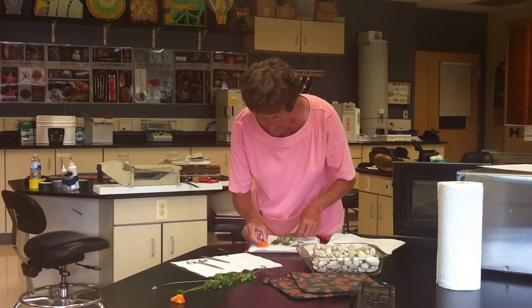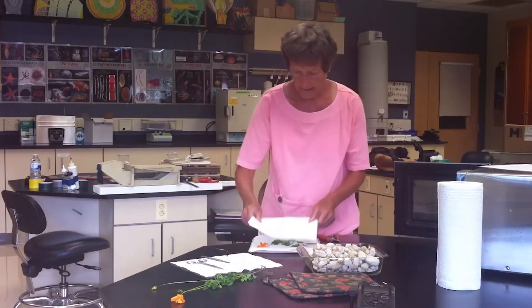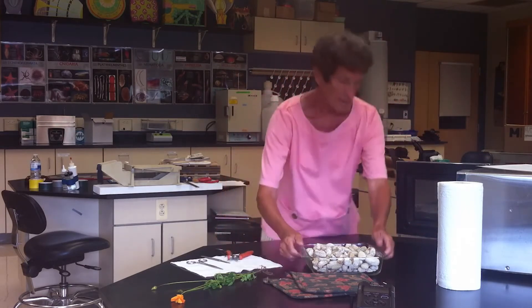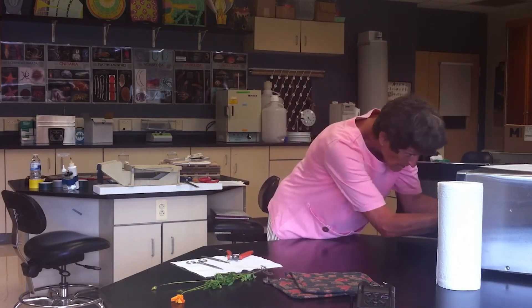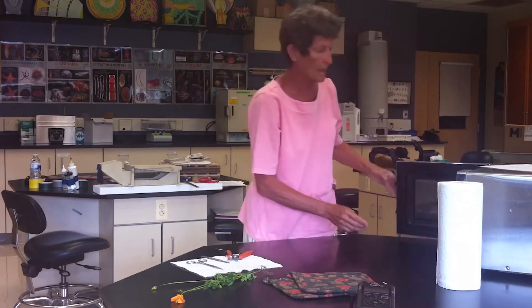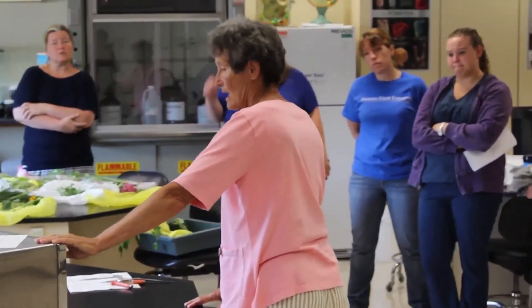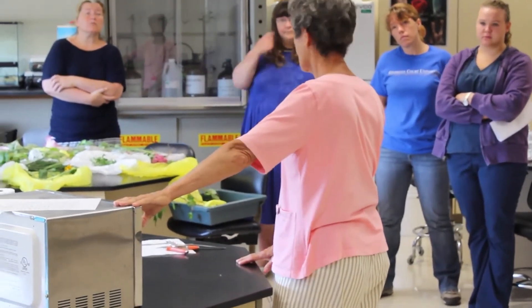The purpose of the paper towels is to absorb the moisture. You place the flat surface on top of the specimen to flatten it, with the stones on top. You will practice and learn how long to dry something for your particular microwave — it's just a matter of practicing a few times. I'm going to try this for one minute; it's probably not long enough, but it may be. When I take it out, the first thing I'll do is check the paper towel — if it's still damp, the plant is damp and you just do it for another minute.